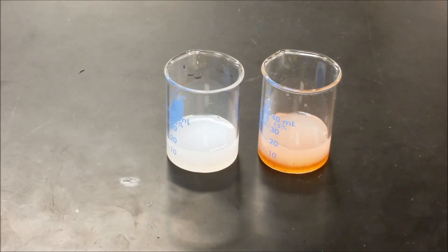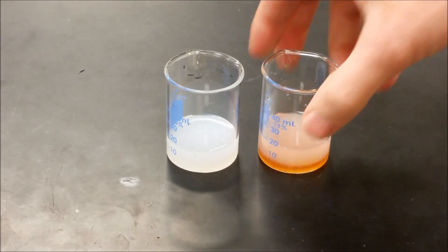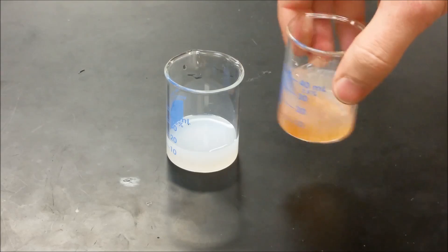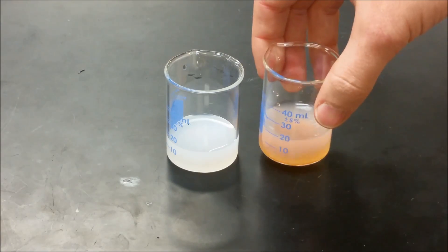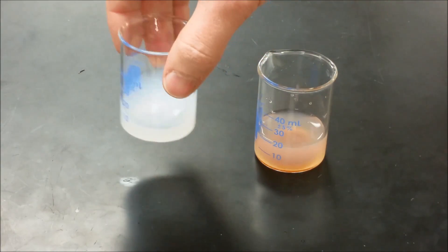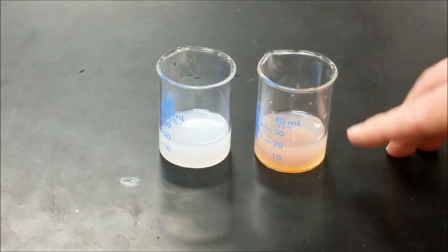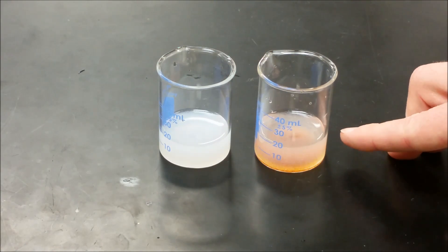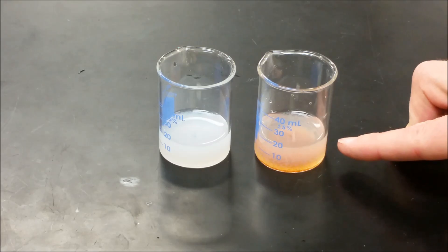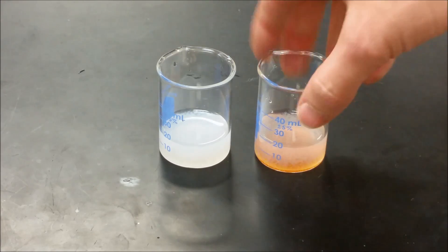So we can see a little bit there, not as much as the other one. Then as we continue to let this mix, we're going to see that the one precipitate is going to linger and this one's going to start to fade more and more. You can already see that a little bit, and so the calcium is being removed from the solution.